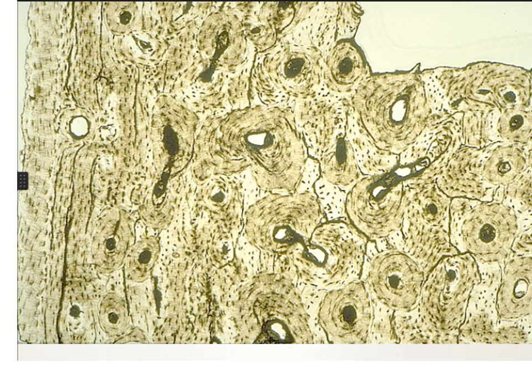Each Haversian canal is surrounded by concentric lamellae of calcified collagen, and in between these calcified lamellae we have the rooms of the osteocytes. So if we have a label here for this area, these are the concentric lamellae, and if we have a marked enlarged picture and we have a label for this black dot here or black line, it is the lacuna.